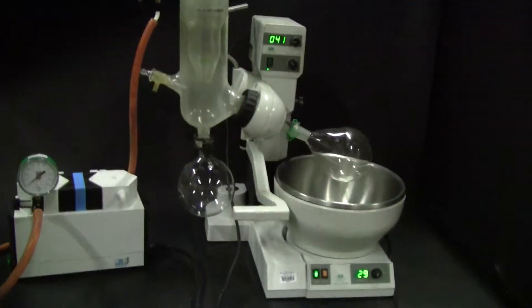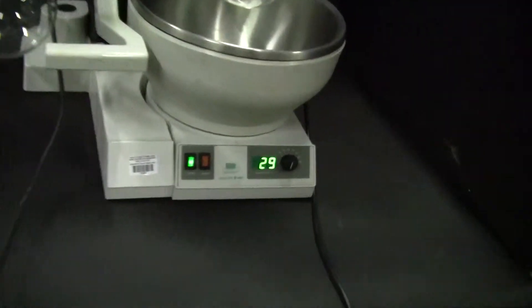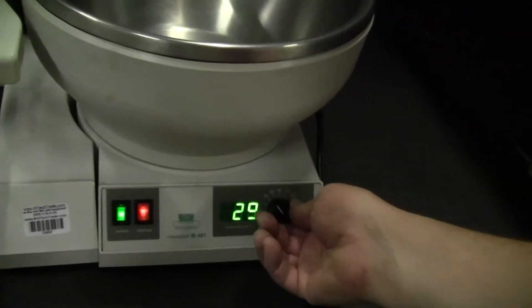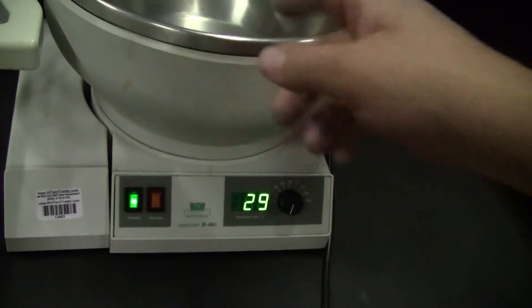This incorporates a B481 water bath, digital water bath, which you can adjust the temperature and you'll see it heat real quick. You don't want to heat it because it doesn't have water in it.